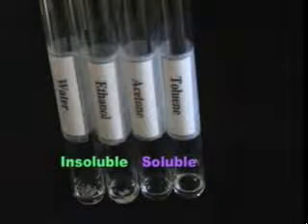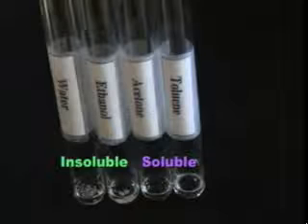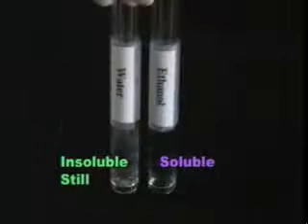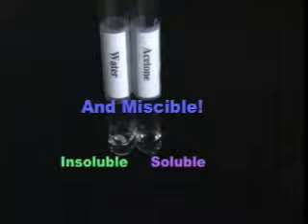We know from our solubility tests that naphthalene is soluble in both toluene and acetone even at room temperature. So which one should we choose to be our solvent 1? That depends entirely on our choice for solvent 2. We know from our solubility tests that naphthalene is insoluble in water even at the boiling point. That makes water a very good candidate for solvent 2. While acetone and water are miscible, toluene and water are not. The recrystallization of naphthalene will be carried out using acetone as solvent 1 and water as solvent 2.